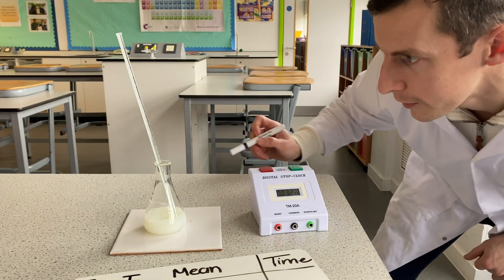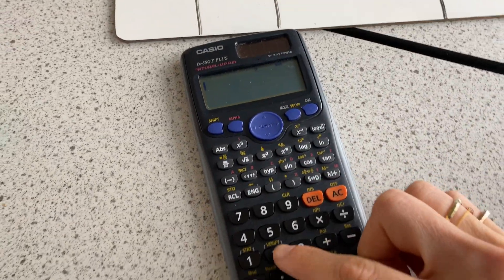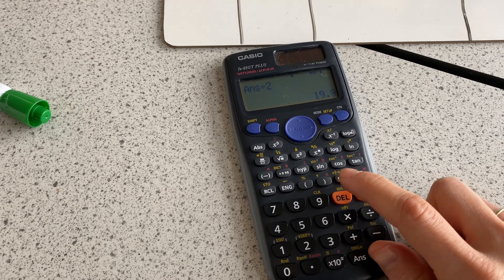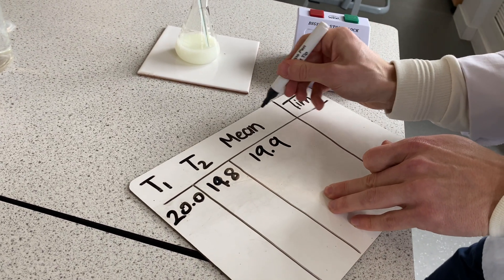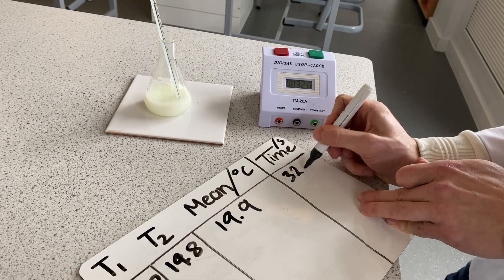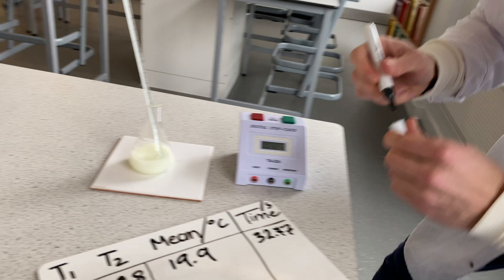The final temperature reads 19.8°C. To find the mean: 20 plus 19.8, divided by two, gives 19.9°C — the mean temperature in degrees Celsius. The time recorded was 32.77 seconds.